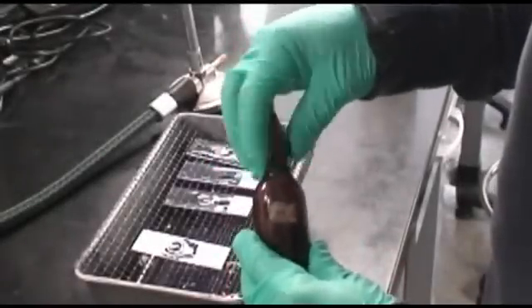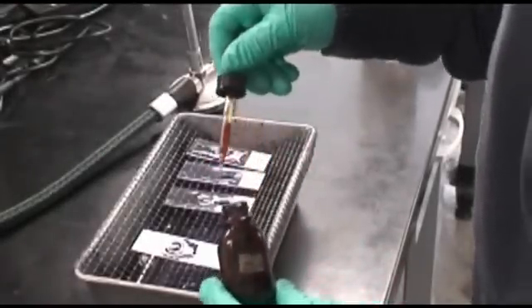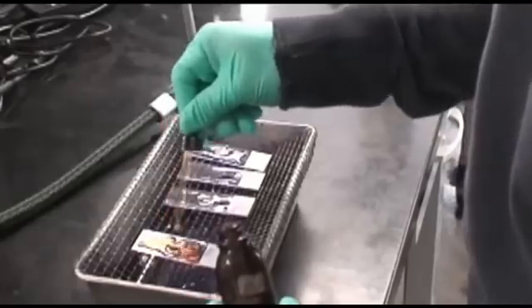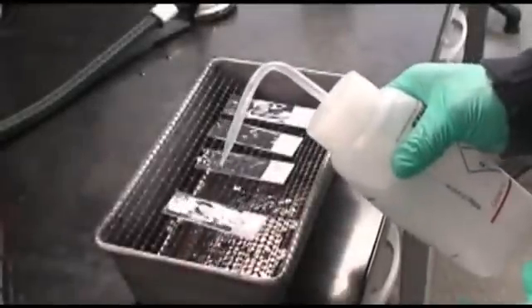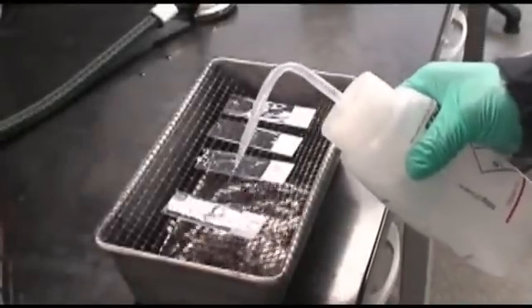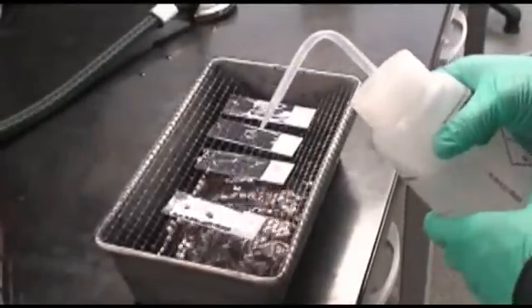Next, Gram's iodine is applied for 30 seconds. Once complete, the slide is briefly washed and flooded with either 70% ethanol or decolorizer.